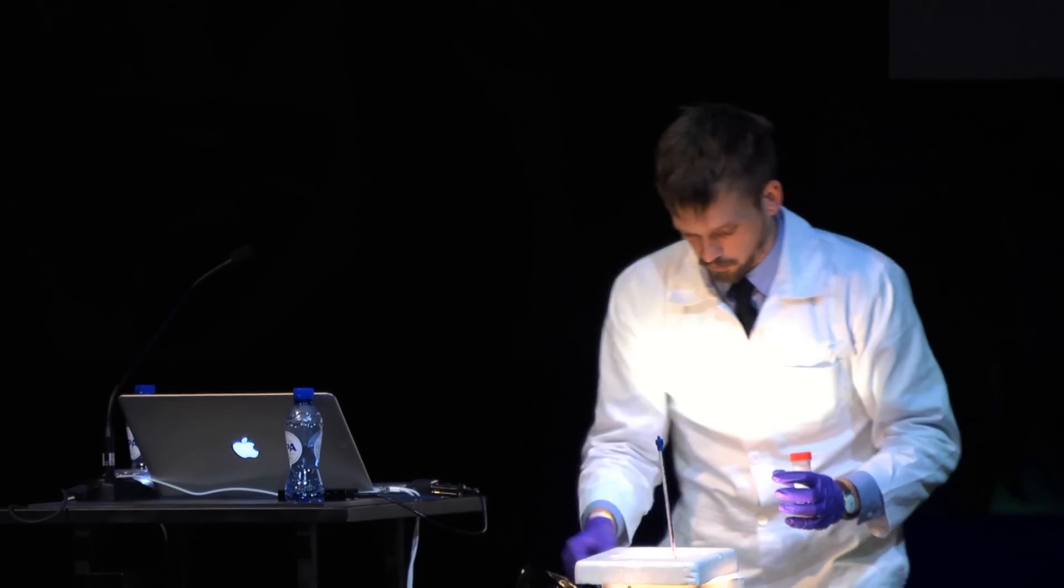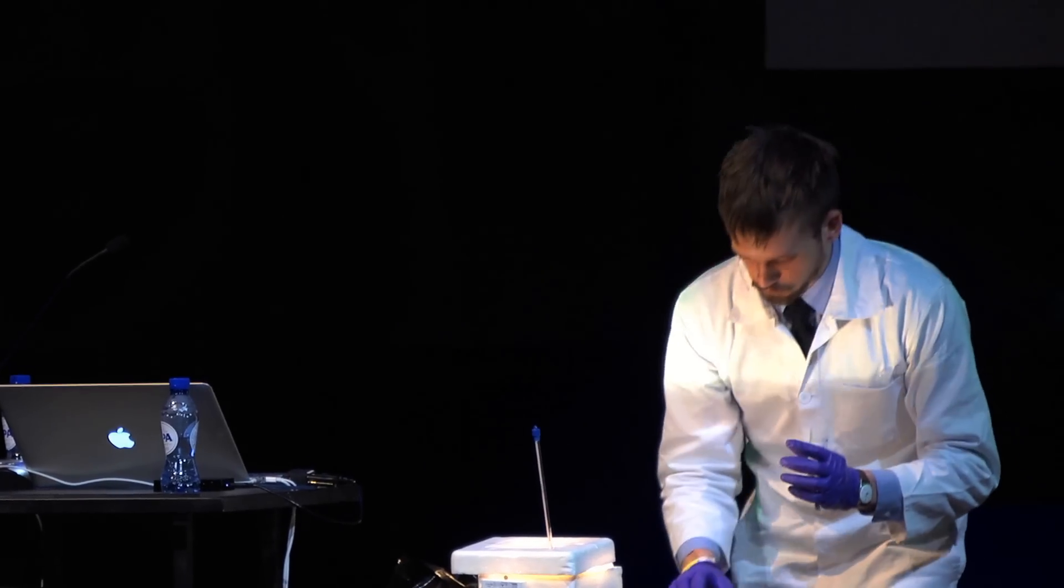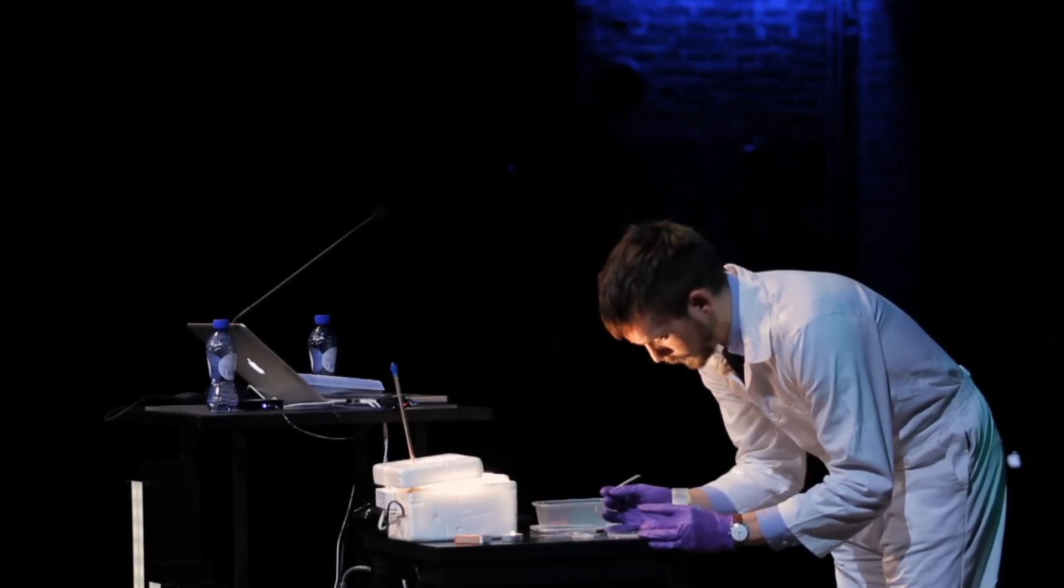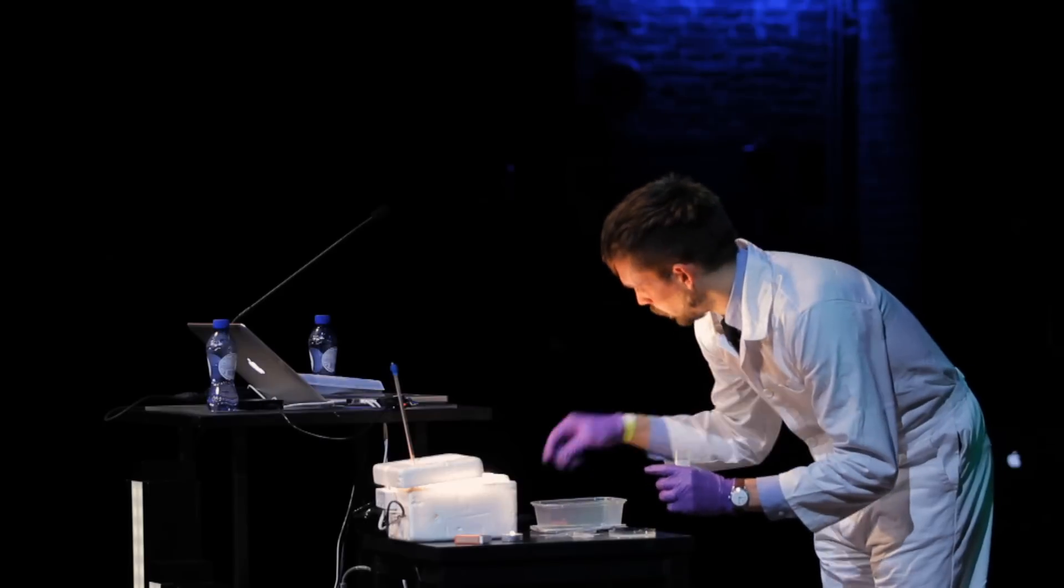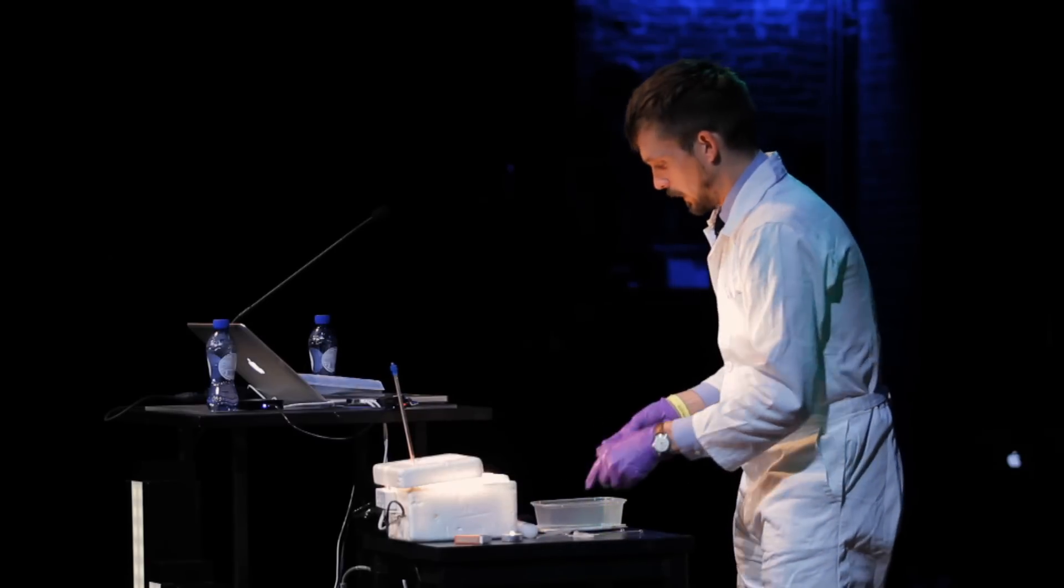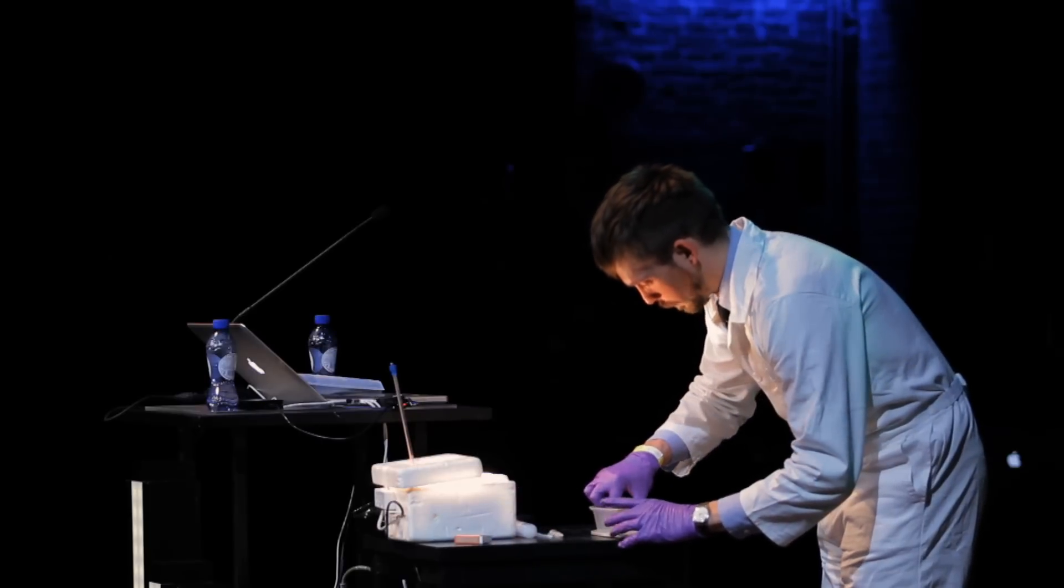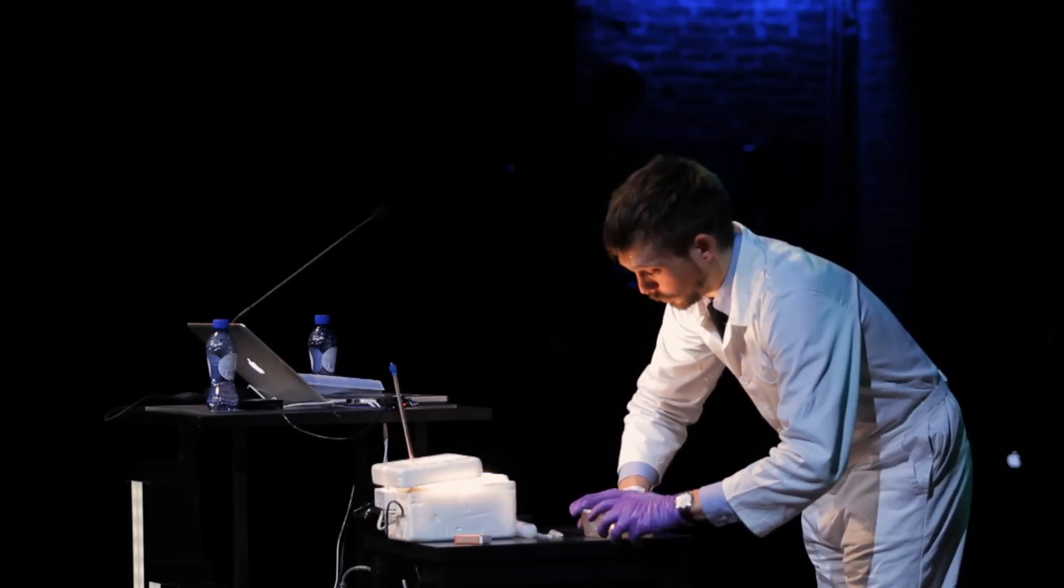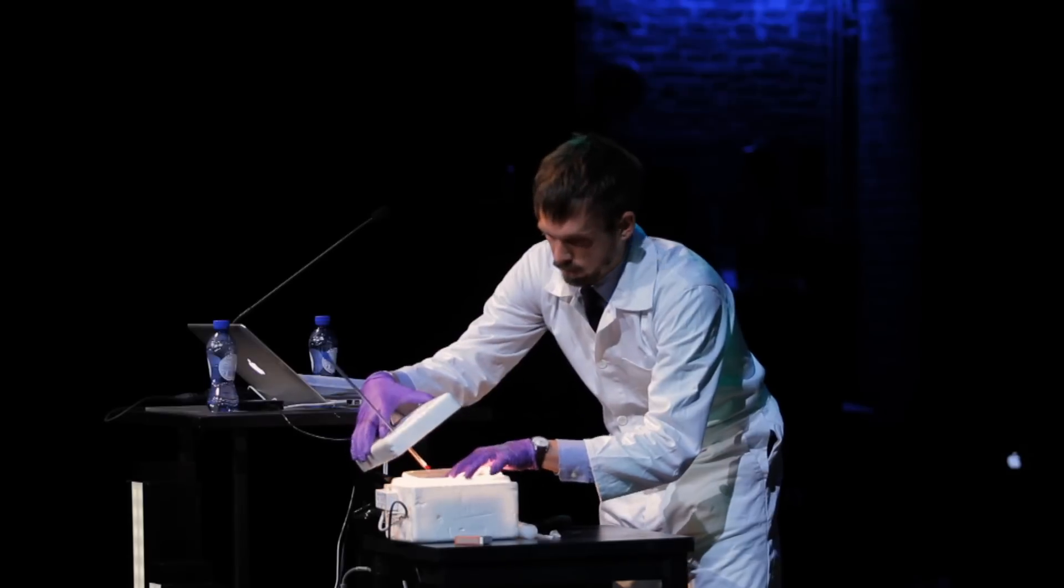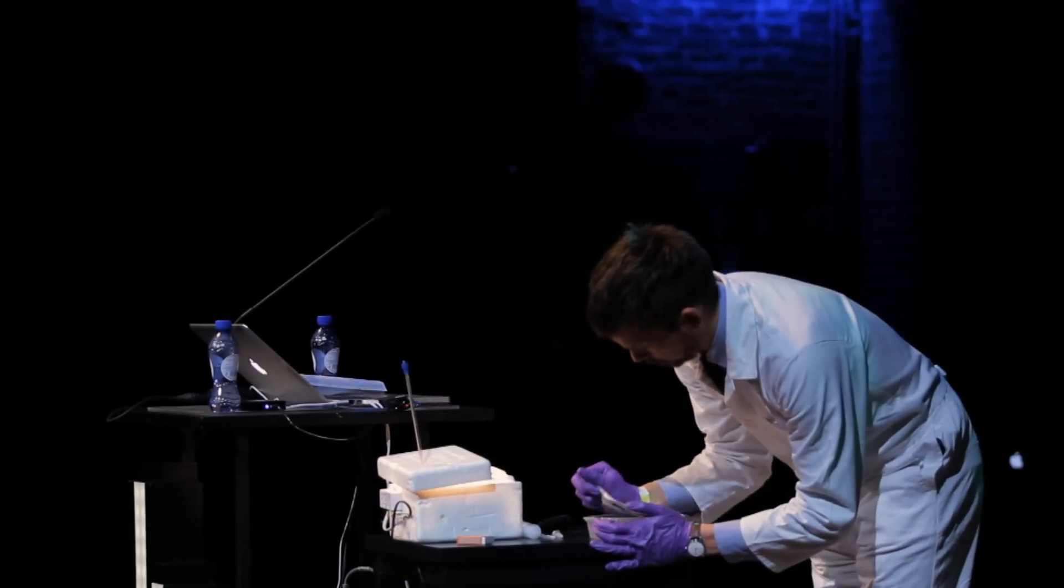Now, what you need to do is, and this is where the candle comes in nicely, you need to incubate this under anaerobic conditions. So basically, you get a little plate of bacteria food again, which is agar, and you streak rather gently the bacteria on the little plate. This plate contains antibiotics. Inside the bacteria, you add a gene that makes it resistant to the antibiotics. So, all the bacteria that grow are the transformed bacteria. You need to incubate it under anaerobic conditions that normally you use quite an expensive device for that sucks out all the oxygen. But you can do it with a Tupperware box, because if you put the candle in the box, it burns all the oxygen. All right, you incubate this for about, there we go. This takes two to three days. So, here's one I've done earlier.